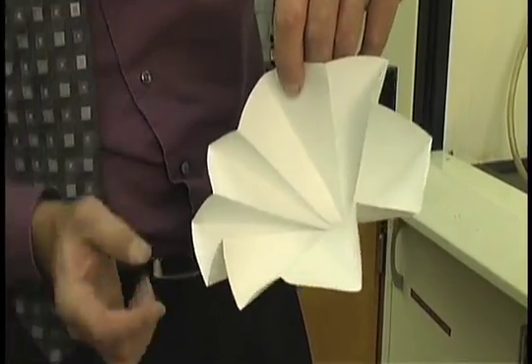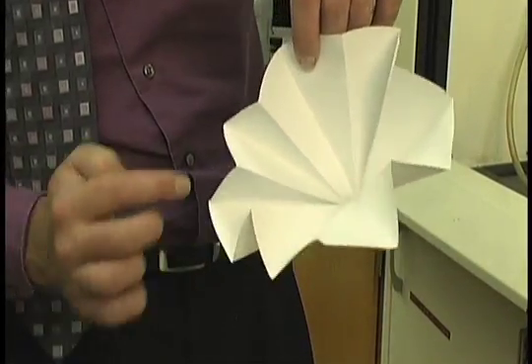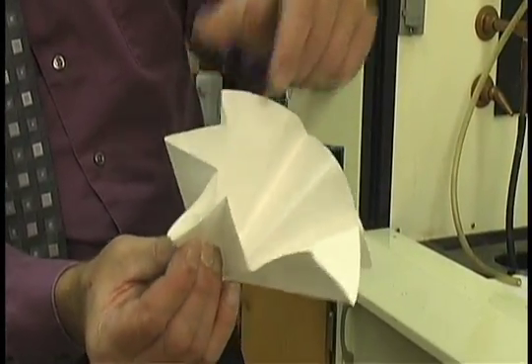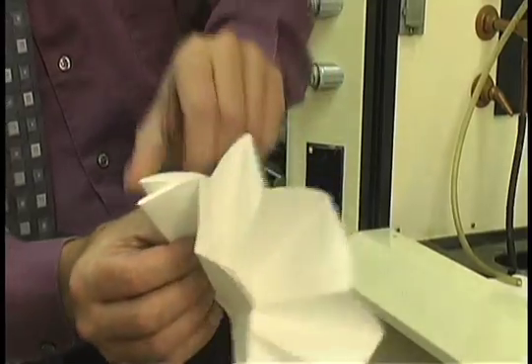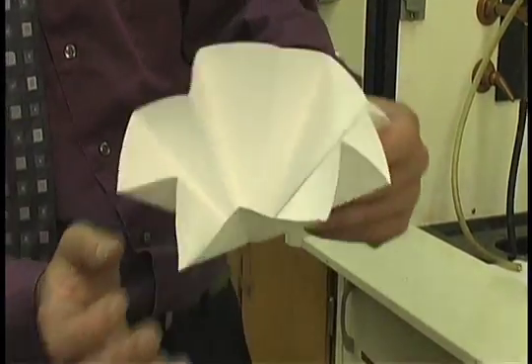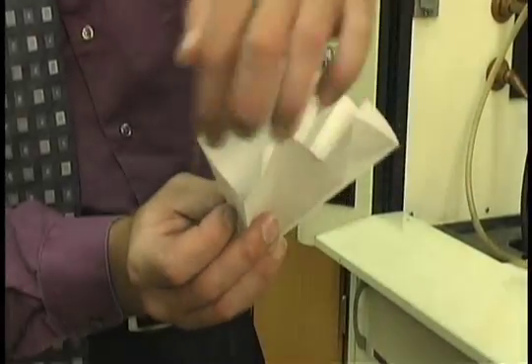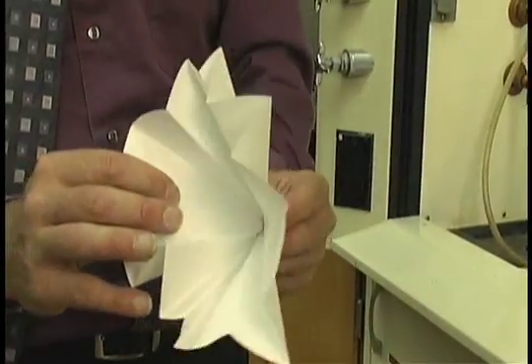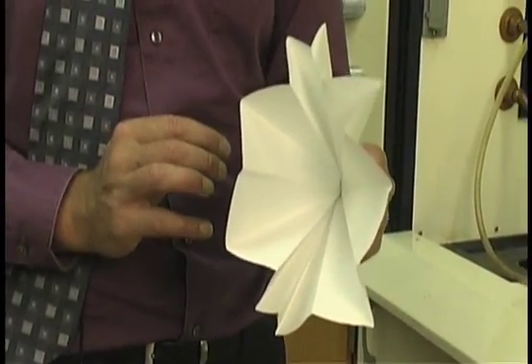This is true all the way around the filter paper except for two sides. Here we have two outside corners. Grab the outside corner, crease it and do the same thing on the other side. Find the two outside corners and then make an inside corner. That is fluted filter paper.